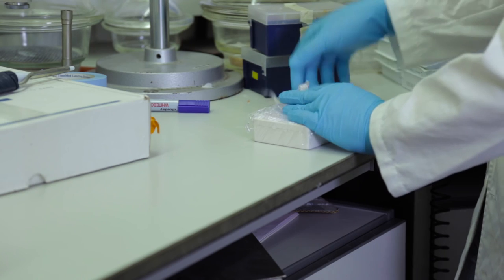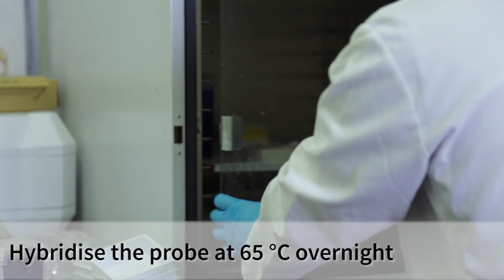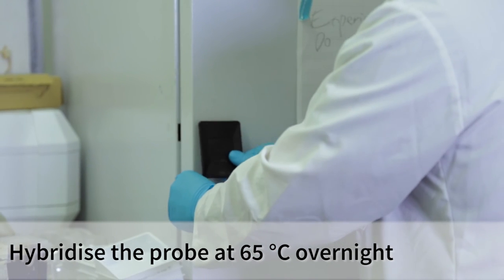Now, I will use some cling film to avoid evaporation. I will leave the slides overnight at 65 degrees in the oven to allow the hybridization between the RNA in the tissue section and the probe.